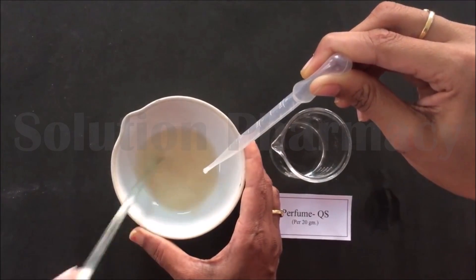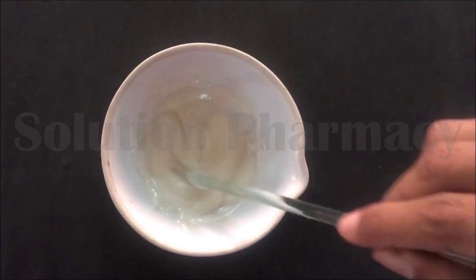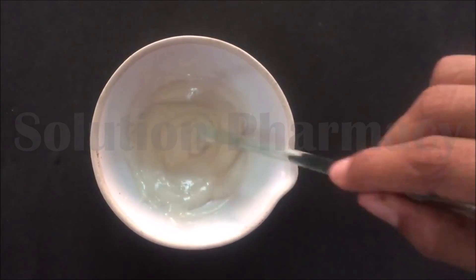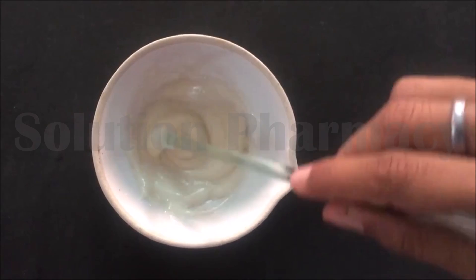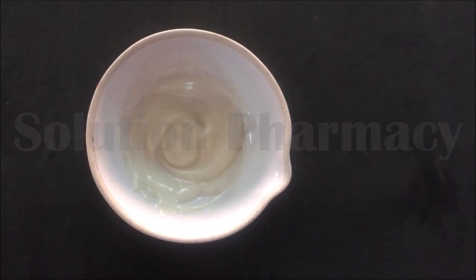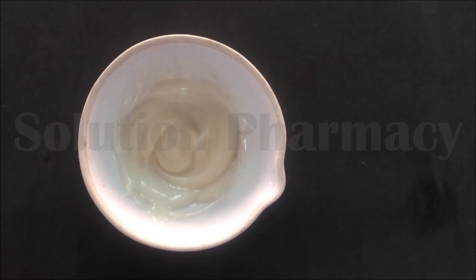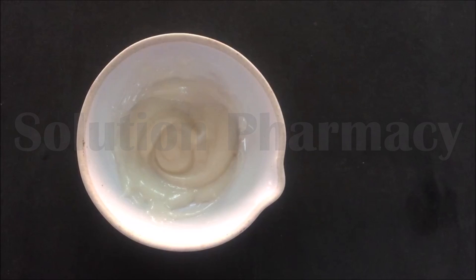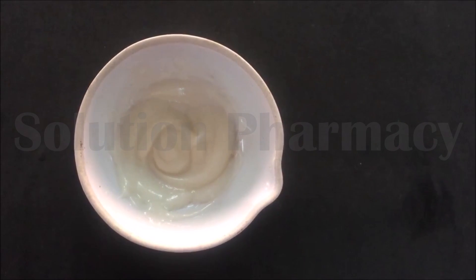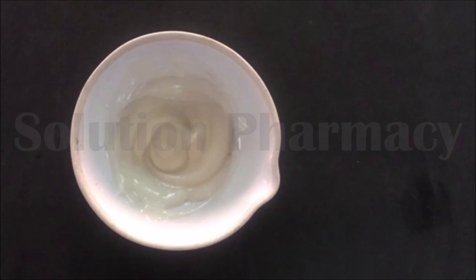Now add one to two drops of perfume — we have taken rose oil. After adding one to two drops of rose oil, continuously mix the contents of the china dish with a glass rod. As the contents of the china dish cool down, the consistency will change and it will become more viscous and finally convert into a semi-solid cold cream form.